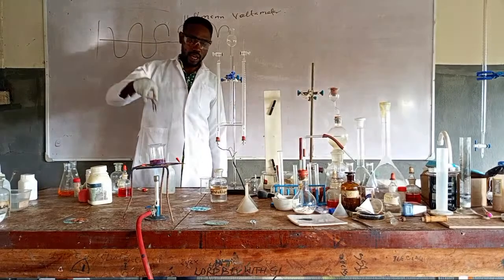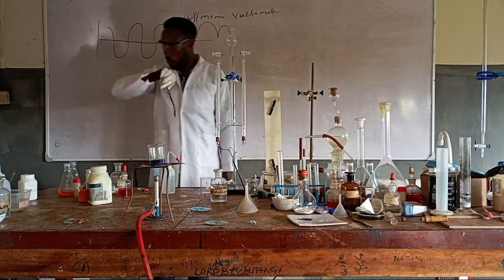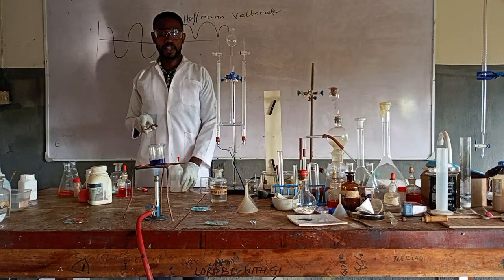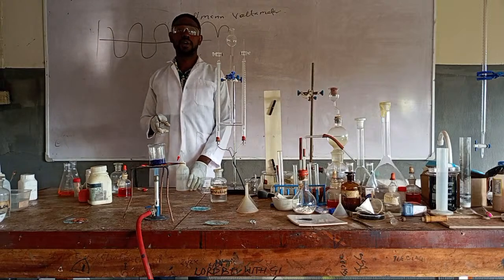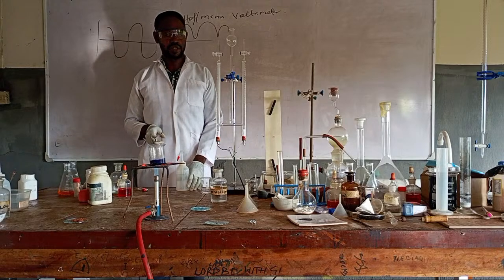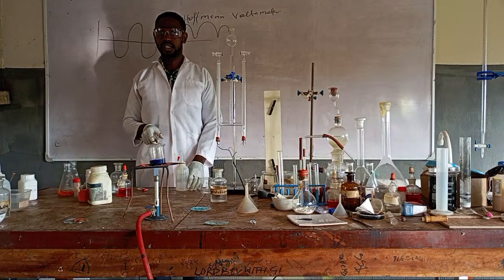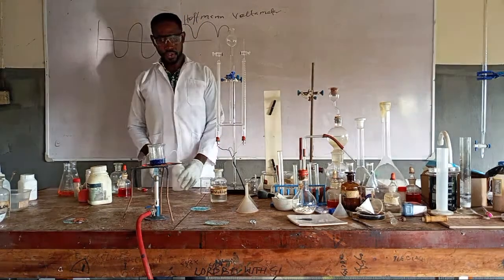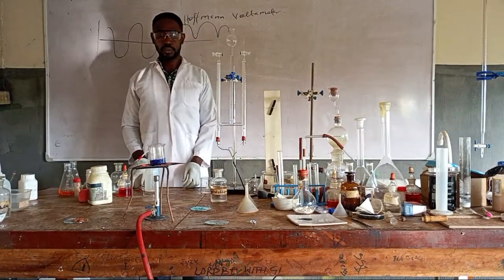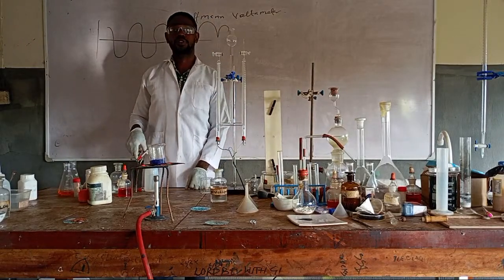And then you now see that on the action of heat, it will turn. Are you seeing it's turning blue already? So we are drying it, we have removed the water of crystallization. When we allow it to stand, it turns back to pink, showing that this air is not dry. Am I communicating? So now I made the paper before you came, by myself. And to keep the paper safe, I stored it between fused calcium chloride.